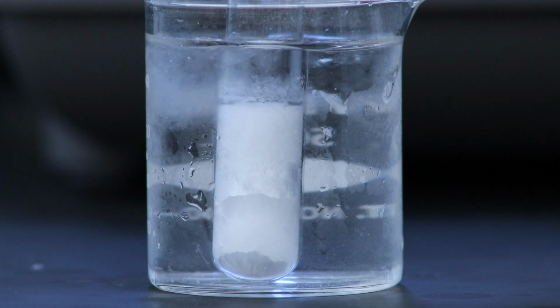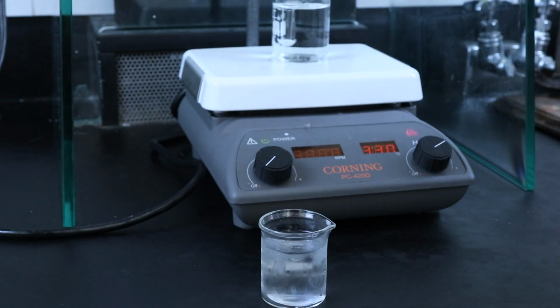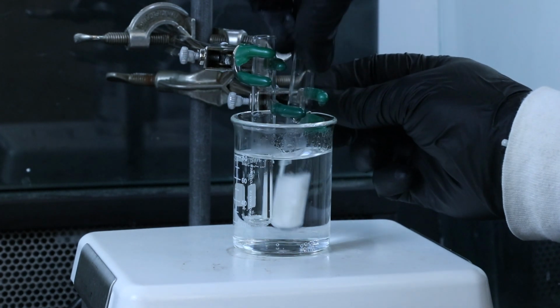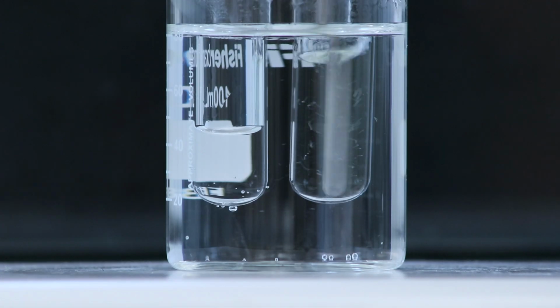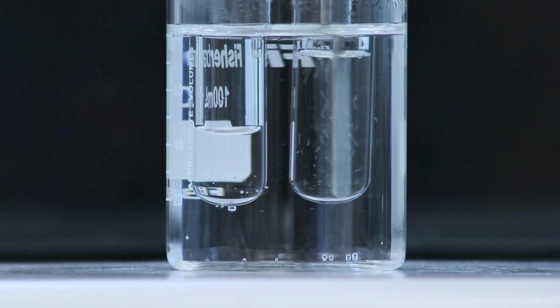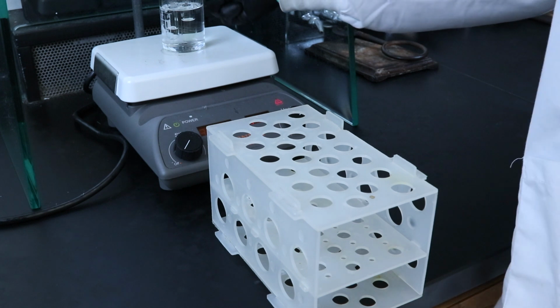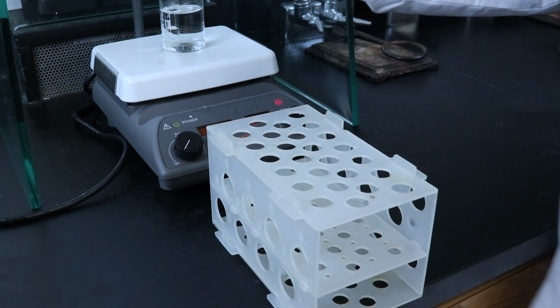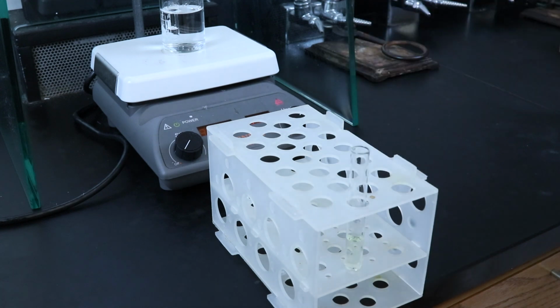To let it recrystallize at room temperature, you want to redissolve the solid so you can take it out of the ice bath and put it back into the hot water bath. Then stir the product until it's once again fully dissolved into the solution. You shouldn't have to add any more solvent at this point because the conditions should be the same. So once the product is dissolved again, you can remove the test tube from the hot water bath and place it in a test tube rack to let it sit at room temperature.